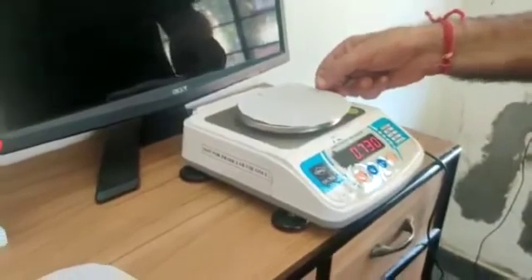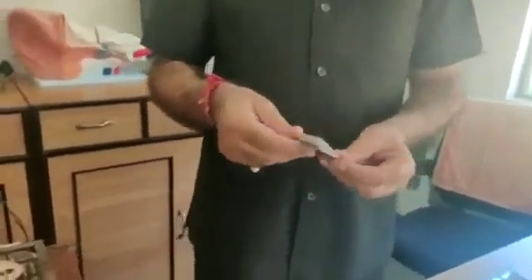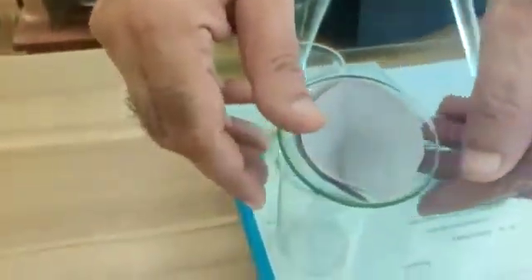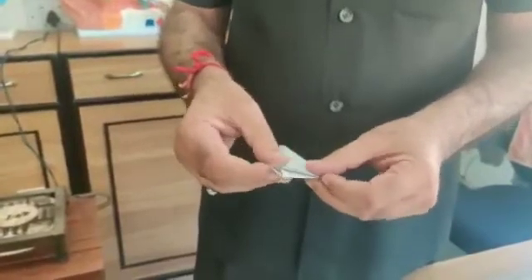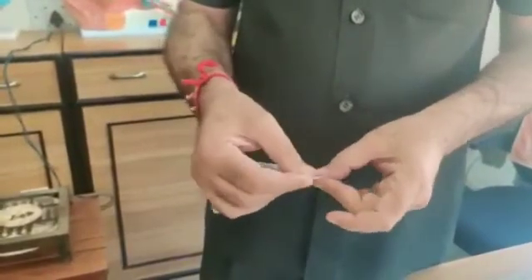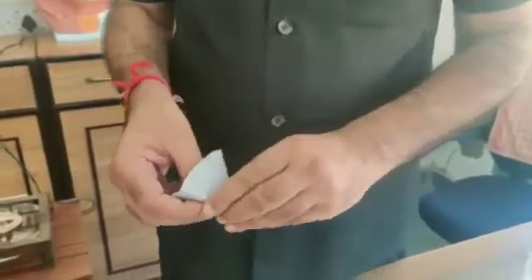Now I will make the filtering cone of these filter papers — like this, it's very simple — and I will fit it in this funnel. And for the other one, prepare its cone and fit it in another funnel like this.